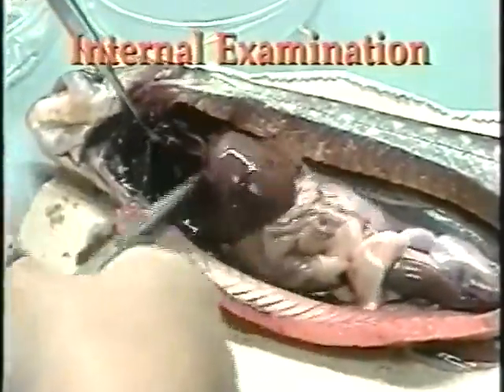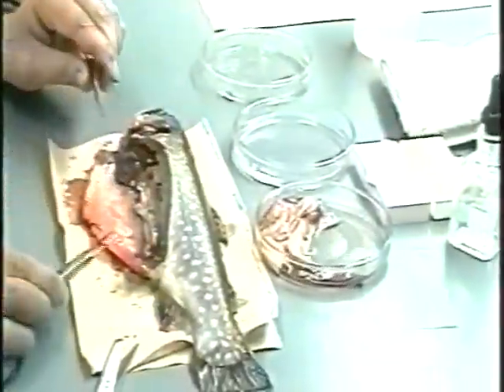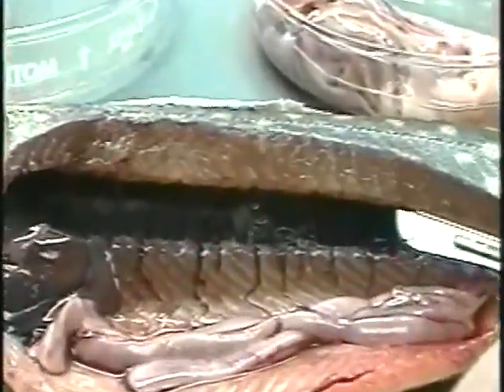After the fish has been opened, the viscera can be removed by cutting the esophagus at the anterior end and the intestine at the vent. The swim bladder is carefully removed, exposing the kidney, which can now be excised.